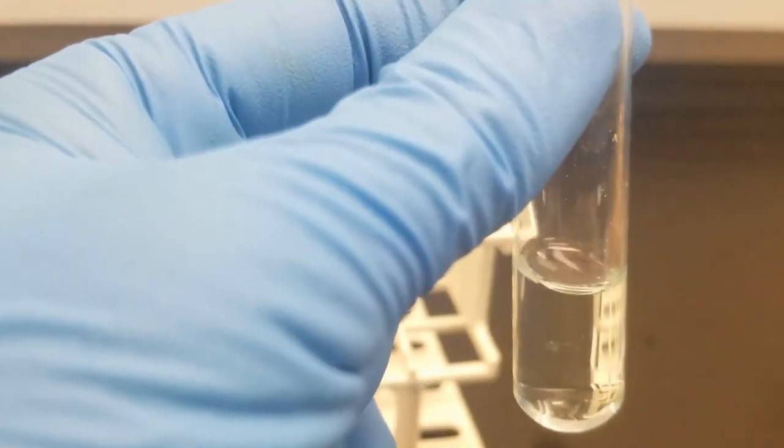So there's your known. Let's take a look at the unknown. Same thing, I think it's a pretty decent camera angle.